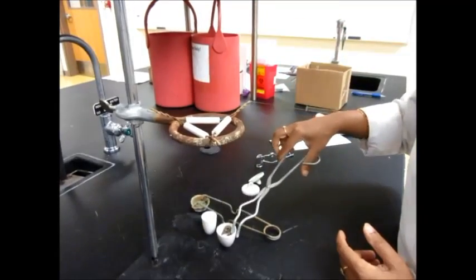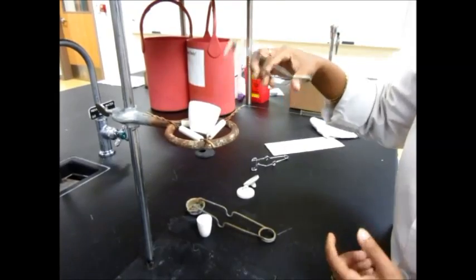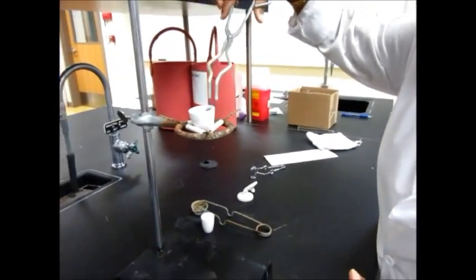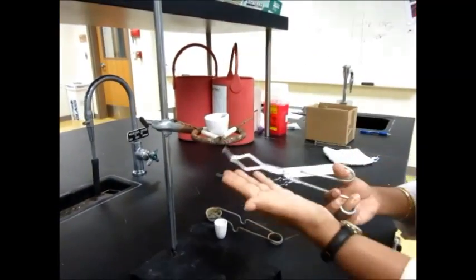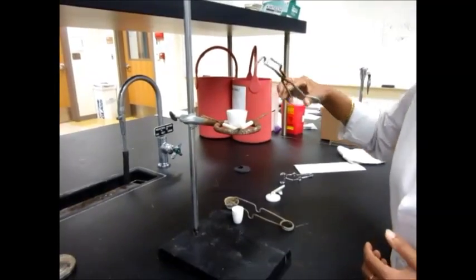But for the one that was a little bit wide, you may not want to put it like this. Maybe you want to put it at an angle. So it's up to you how you want to do it. I'm fine with everything so long as your base gets heated properly, depending on what you're trying to do.